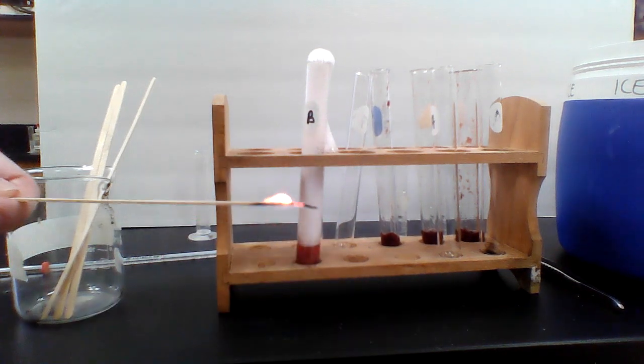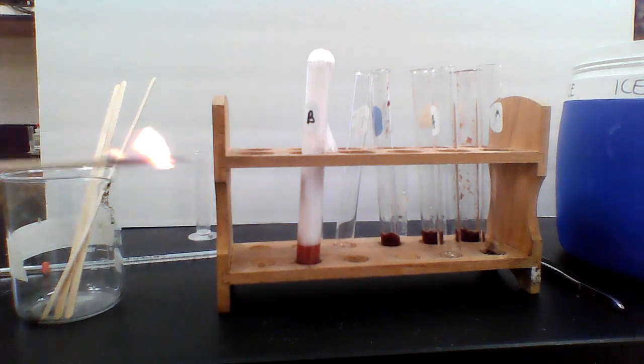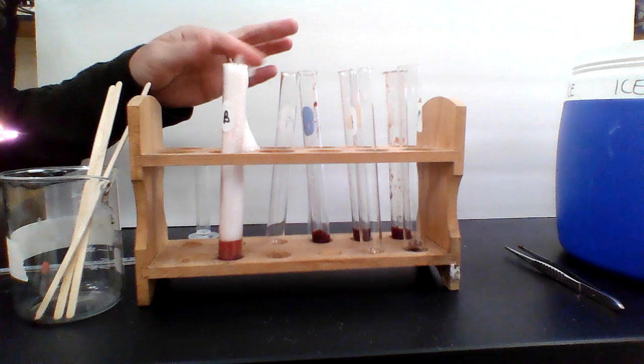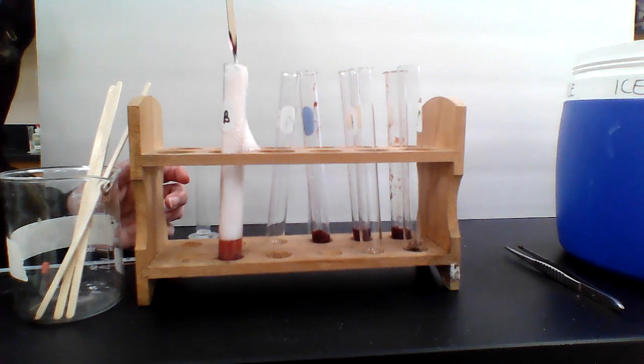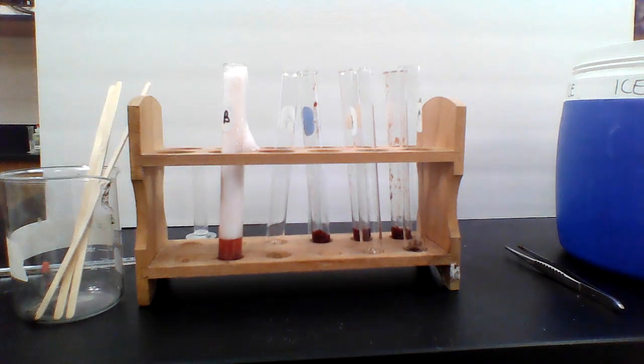So we'll take a look. Come on. Starting on fire. I'm going to blow out some of the bubbles just a little bit to see if I can get it to... Nope, I can't really. The bubbles get it wet. So I blew out my splint, and now I'm going to put it in there. And yeah, the bubbles just get it wet, but you have to trust me that it is lighting. It's going poof, a little flash is coming up, but it doesn't work very well when the bubbles get it all wet.